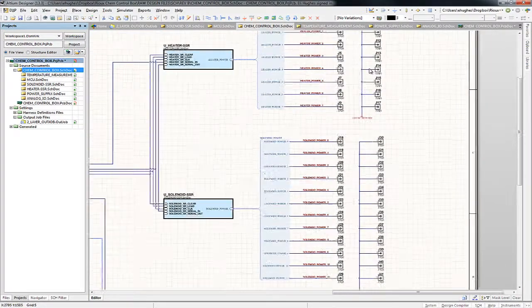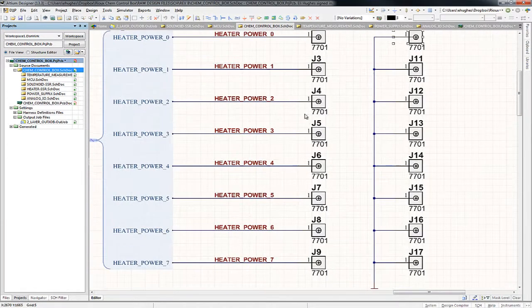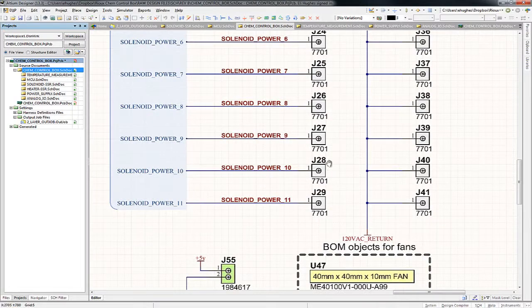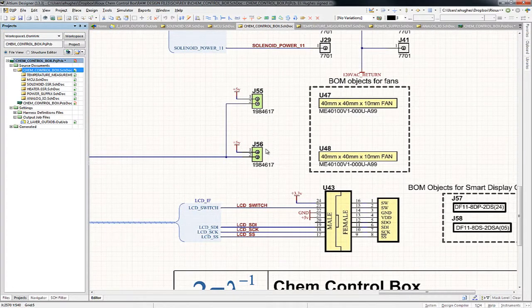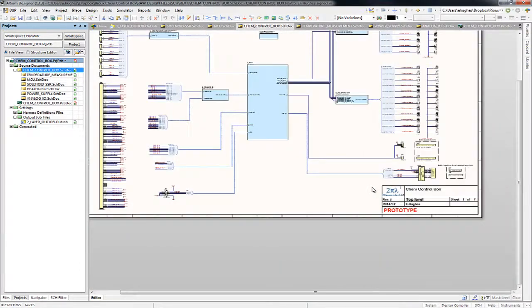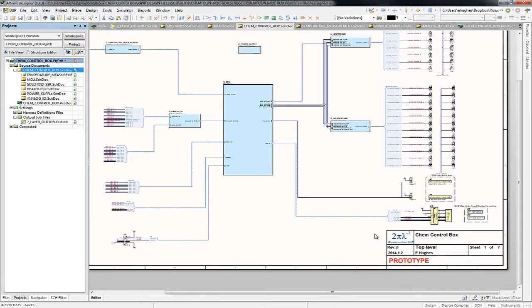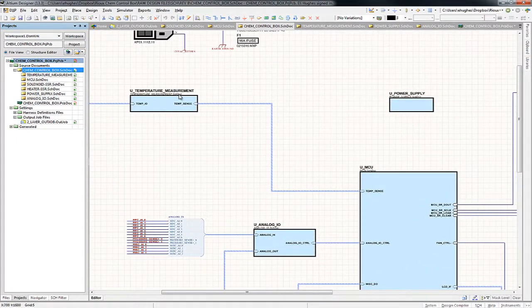On the right-hand side, we can see all of the screw terminals for the heater outputs and the solenoid outputs. I show the green connectors that are used for the fan connections. And lastly, there's some connectors for the LCD screen. So really, the only thing this top level is showing you is the overall flow. These boxes in the middle represent, at a block level, the other schematic sheets.